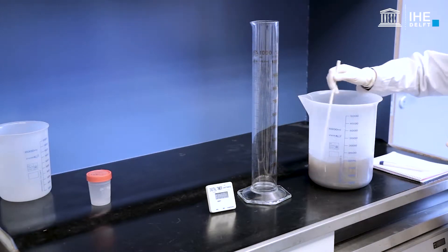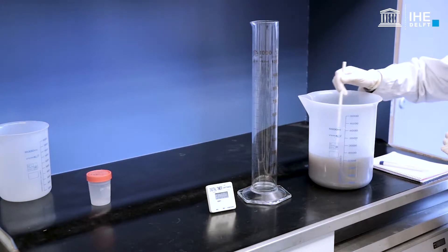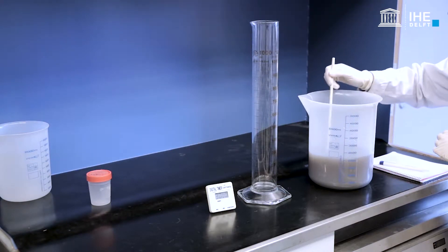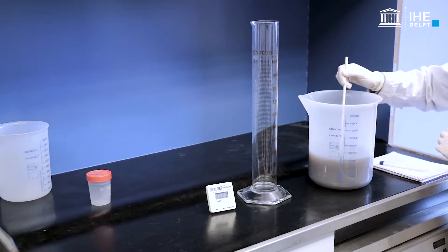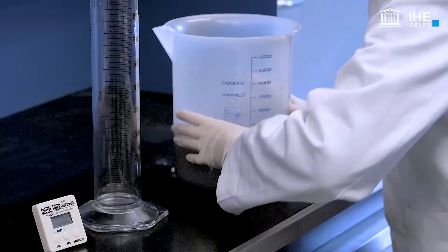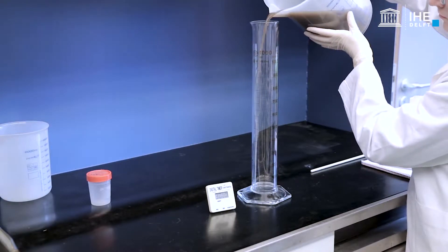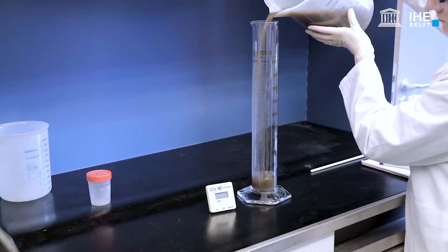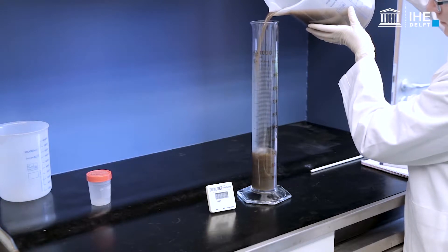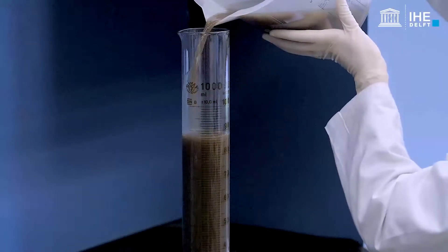Stir the sludge sample slowly with a stirring rod. It is very important to avoid disturbance of the flocs. Gently pour the homogenised sludge into the graduated cylinder.